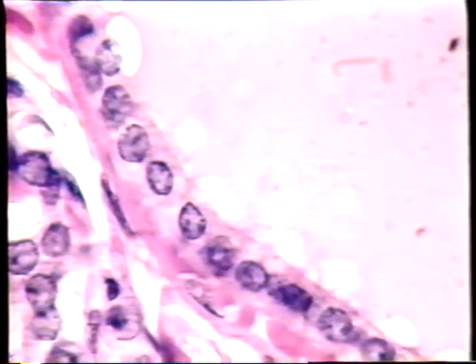This is a higher magnification image of the simple cuboidal epithelium that lines the follicles of the thyroid gland. The arrow is pointing to the surface of the epithelium, and the surface contacts the colloid, which is the pink material in here. Right underneath the epithelium is a capillary bed. You can see a capillary running along here, and you can see the individual red blood cells here and here. This simple cuboidal epithelium has a row of nuclei which are quite prominent. These nuclei appear as oblate spheroids. They're purple. The cytoplasm is pinkish.